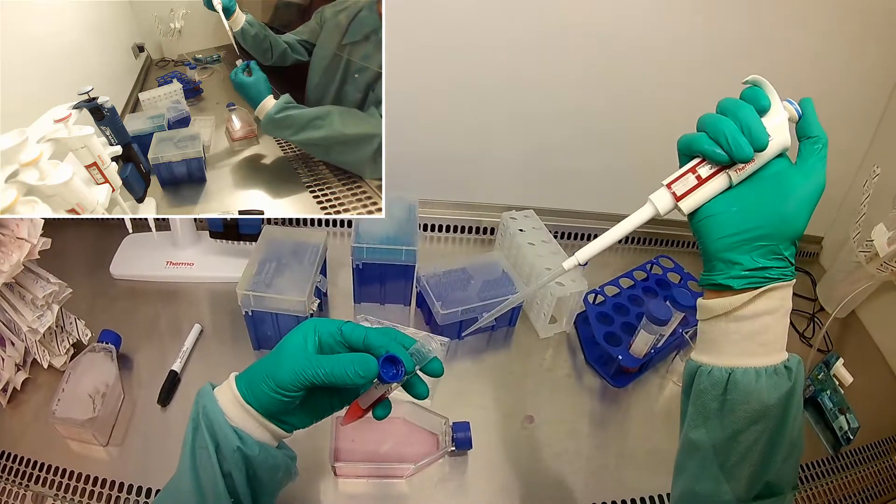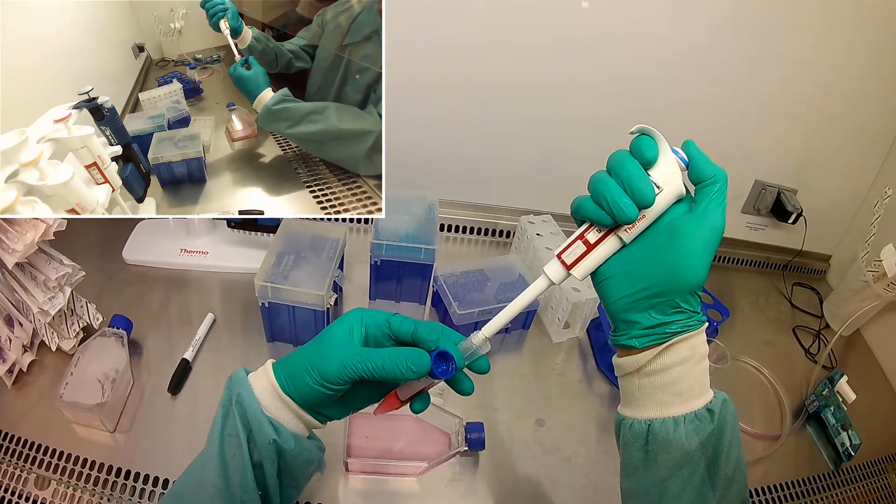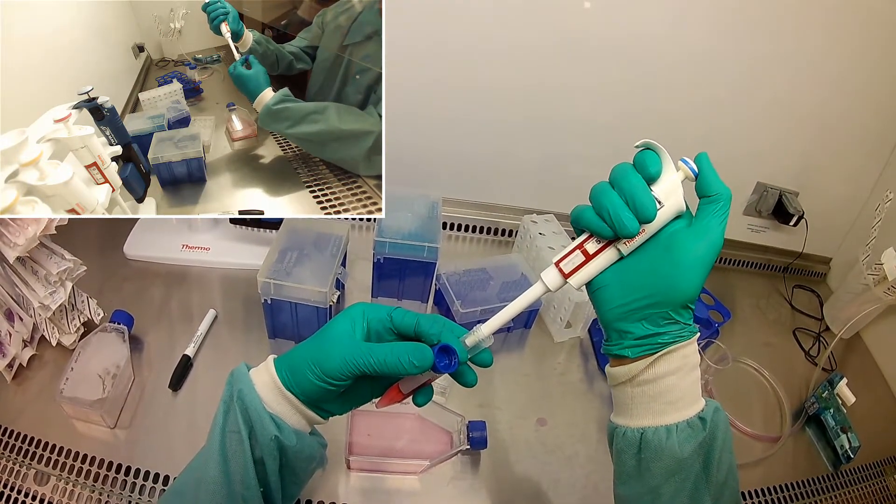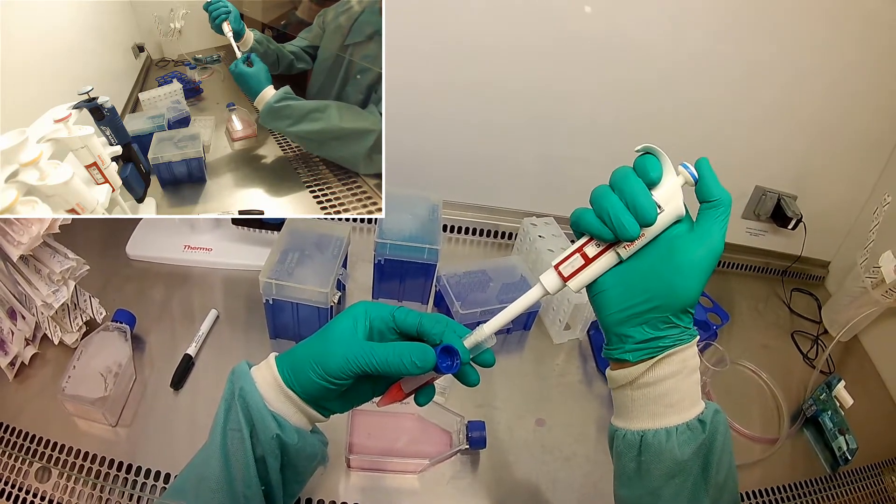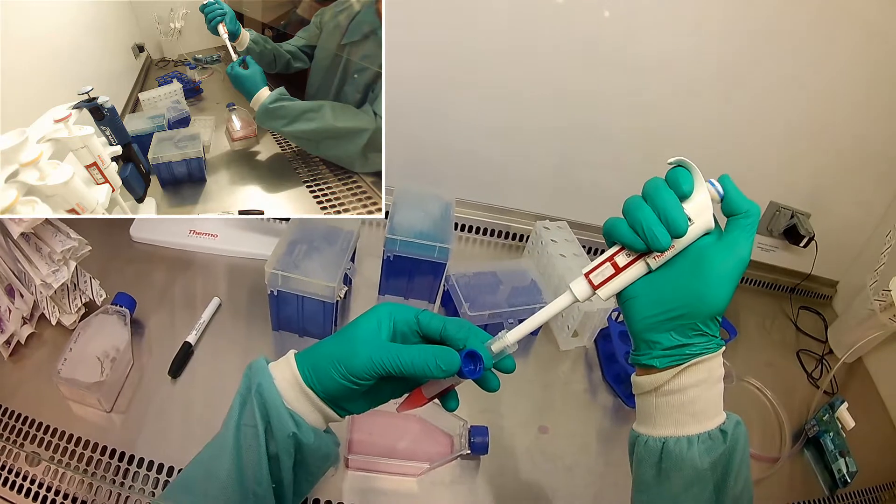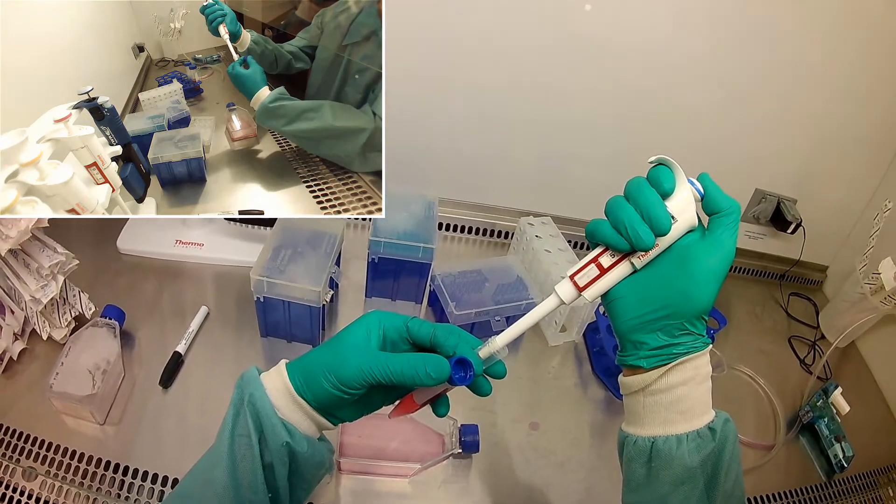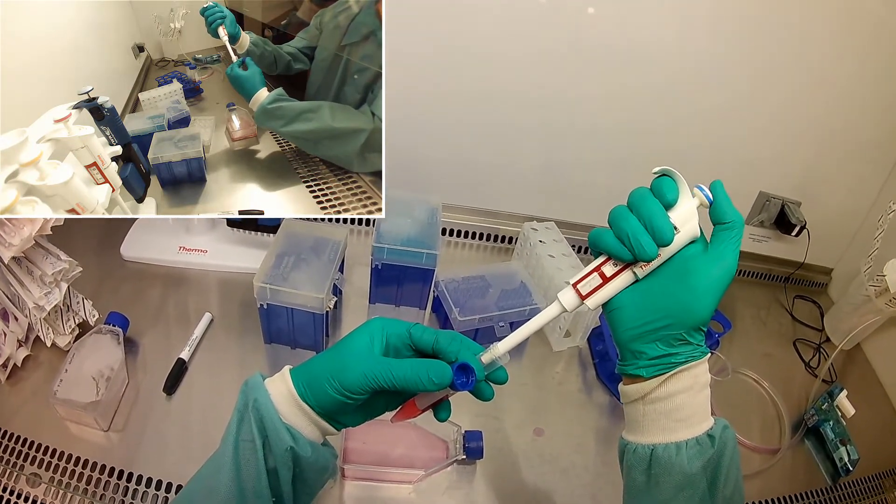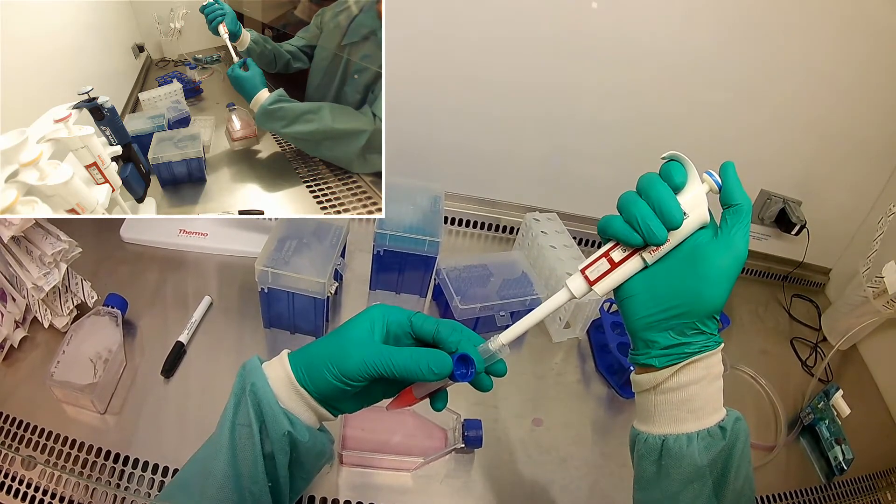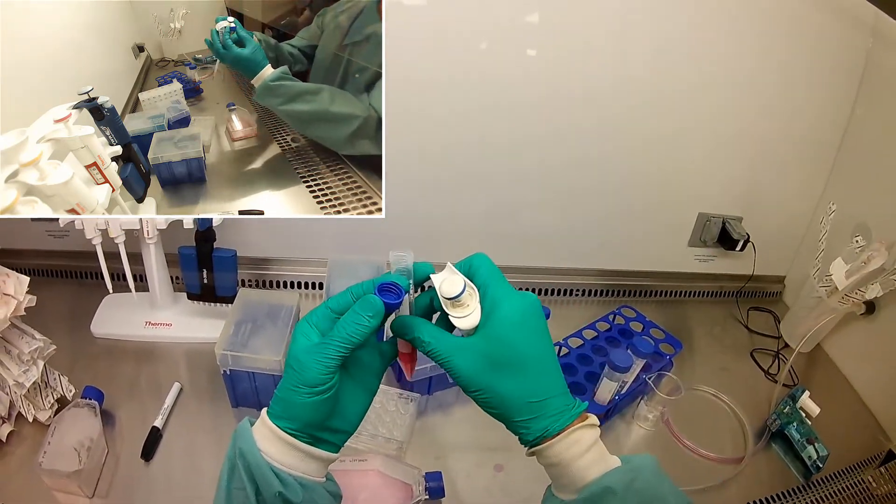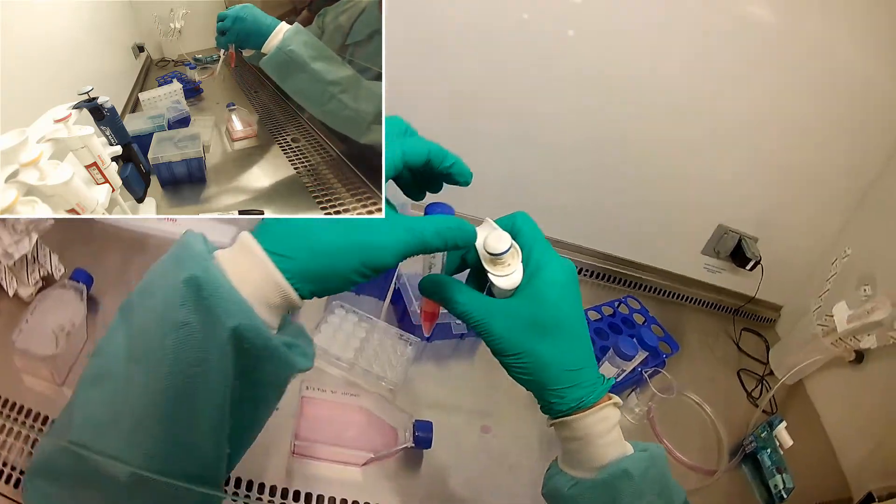And so I'm going to make sure I mix these really well. Sometimes when the cells have been sitting when you're counting, they tend to follow gravity and go down to the bottom of the tube. So it's good to mix and make sure that you avoid that.